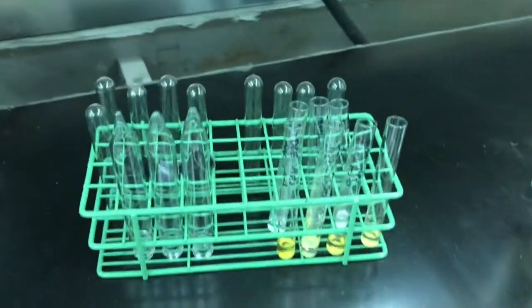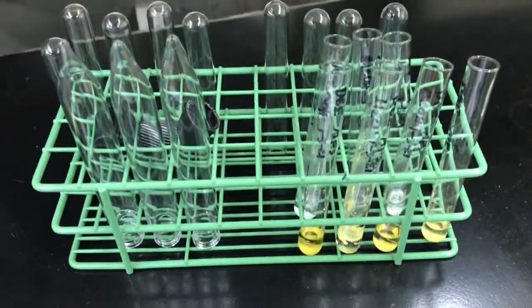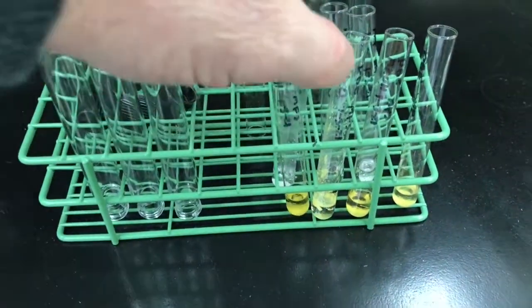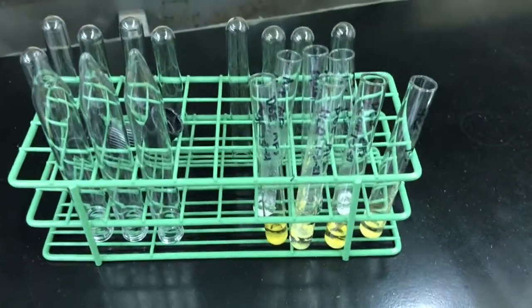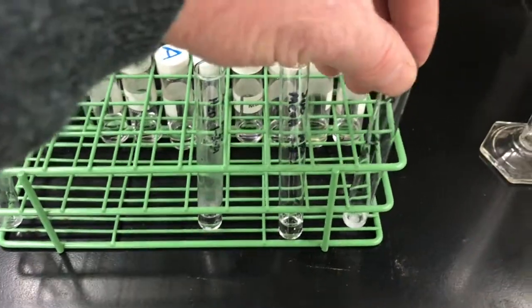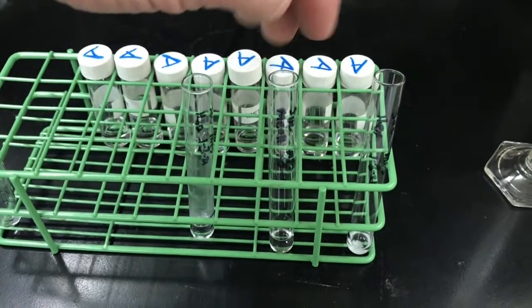Most organics can't go down the sink drain, such as dibenzoyl ethylene. We don't want to put that down the drain, we'll put it in our waste bottle. Also, the hexane solvents, they'll always want to go in the waste bottle too. Only things like maybe succinic acid, that's a common thing in nature, can probably go down the drain, but not in the hexane. You don't want the hexane going down the drain.